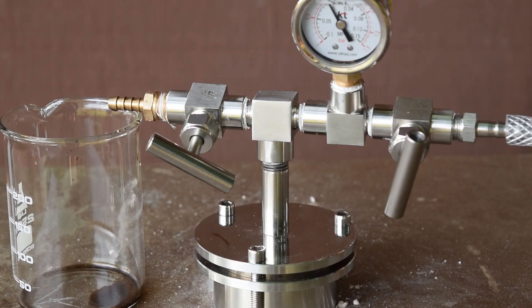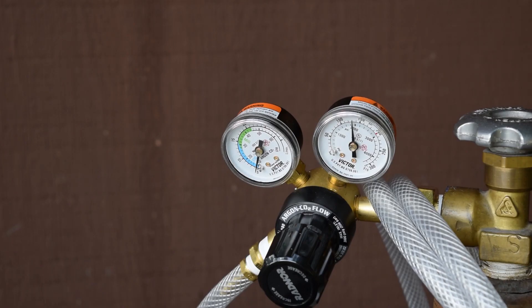For the first few minutes, there will be some liquid that comes out, but that will stop. I am flowing argon at just a few liters per minute.